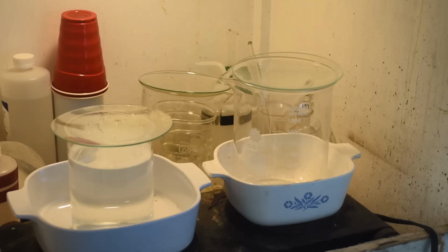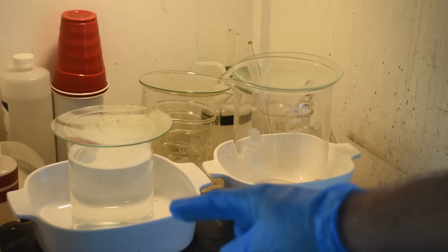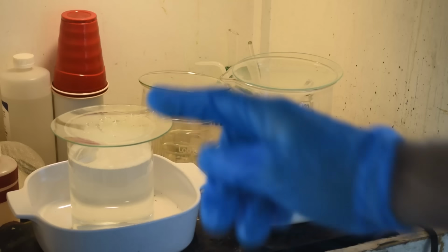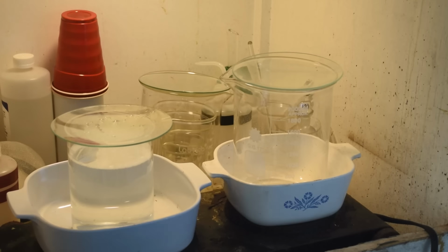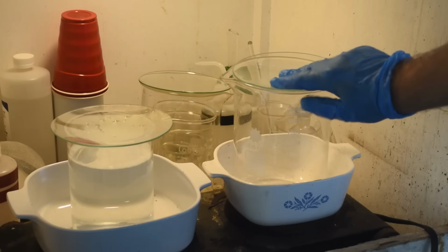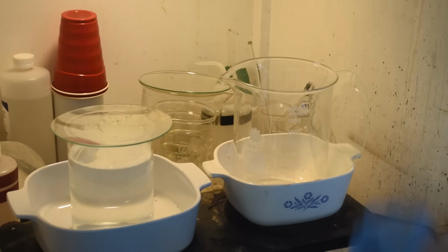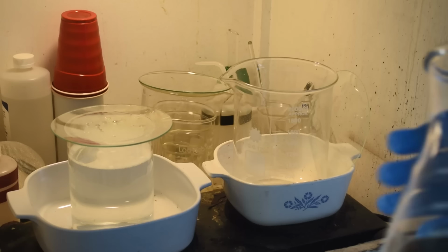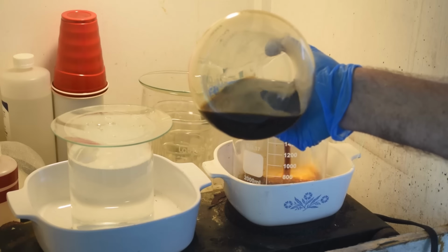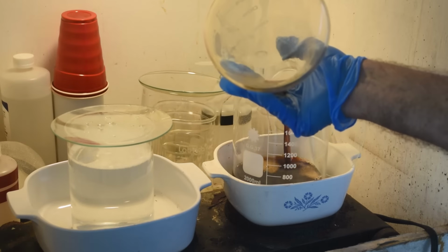All right, so I have been to the store, got some more ammonia. I have mixed up another batch of ammonium formate solution. I'm not going to make you watch that again, so I just did that off camera. And I don't have another really tall beaker, so we're going to go a little dangerously and see if we can do the conversion in this shorter beaker. There wasn't a whole lot of initial foaming first time around. Maybe I got lucky. I guess we'll find out.